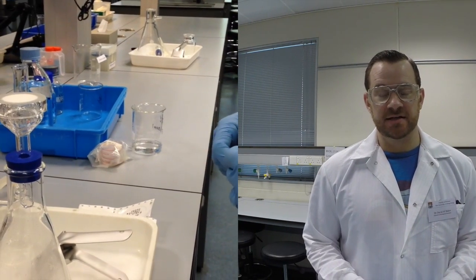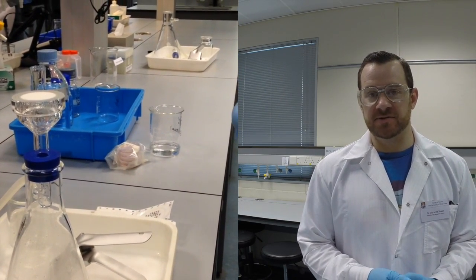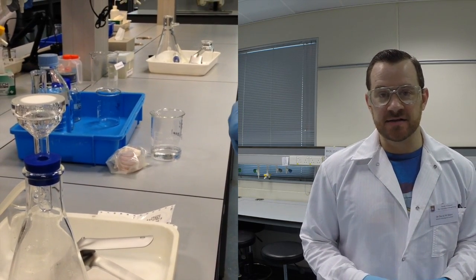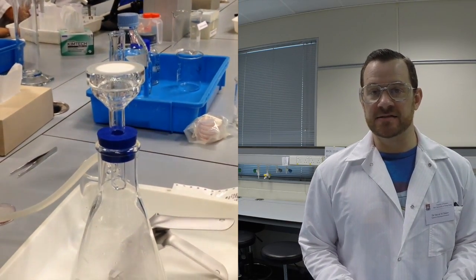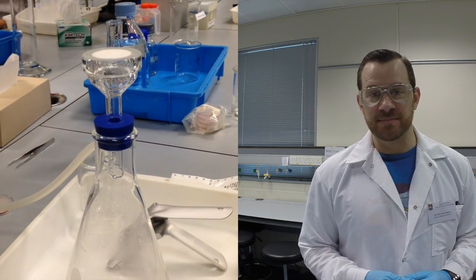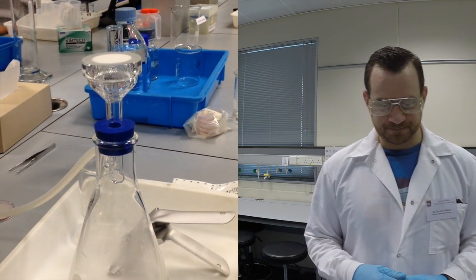Okay, we're going to continue to use this vacuum filtration technique to help us understand what is the loading of microbes in the water samples we're taking. Today we're specifically interested in measuring Enterococcus, which is a group of fecal-associated microbes that are very abundant in the guts of mammals. And the most abundant mammals in Hong Kong just happen to be us. So we're going to be measuring the microbes that are coming out of our guts in our waste.